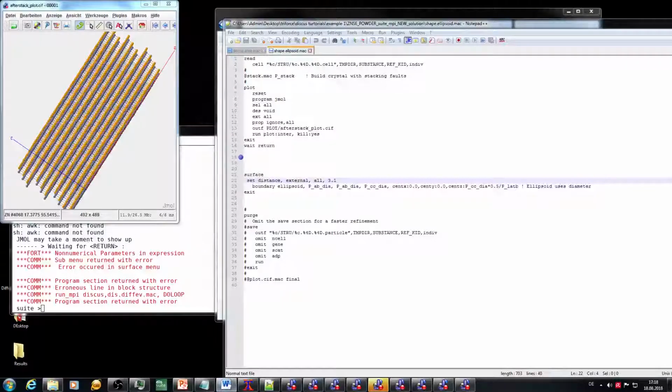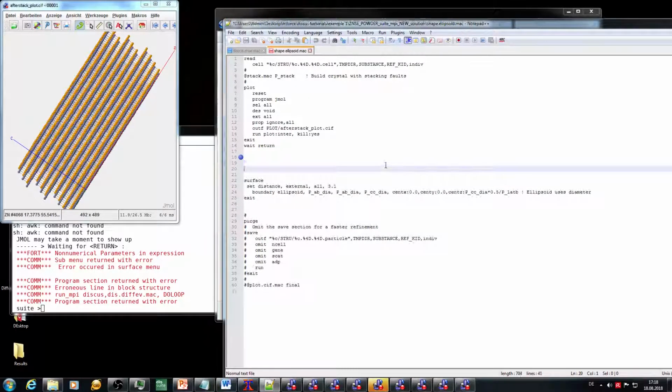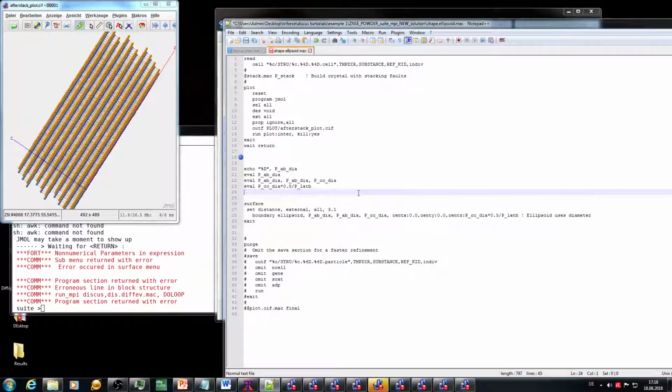What can you do in this case? You need to ask whether the parameters are correct. These are commands with which you can check parameters. Again, the echo command is giving you out the line afterwards, just printing %d. D is for the number, C is for character, so for string. Another possibility is the evaluate command, which is pretty much calculating whatever is written behind the evaluate. And I did that a few times, just with the first parameter here, and then with 3 parameters, and then with the parameters over there for the center.